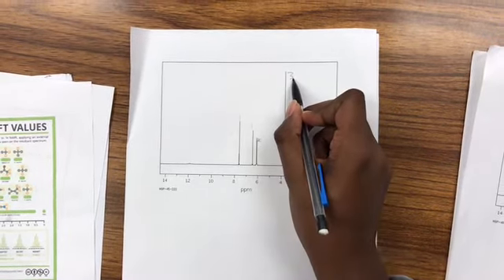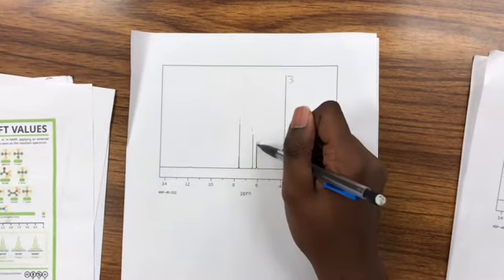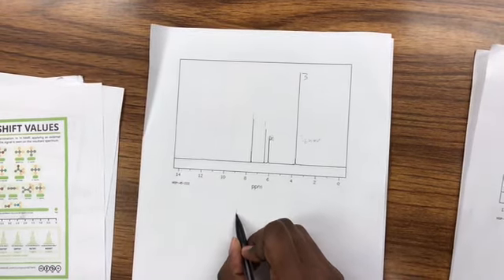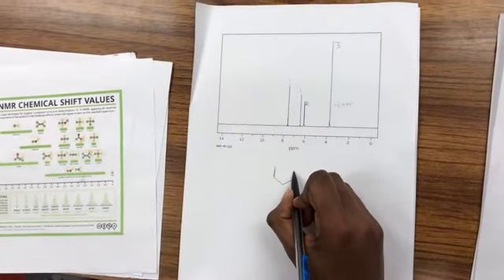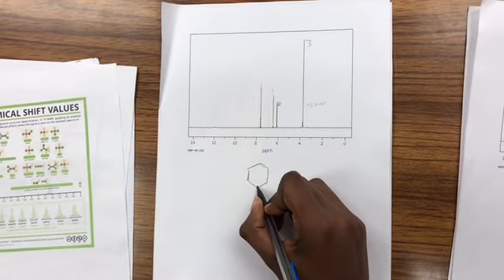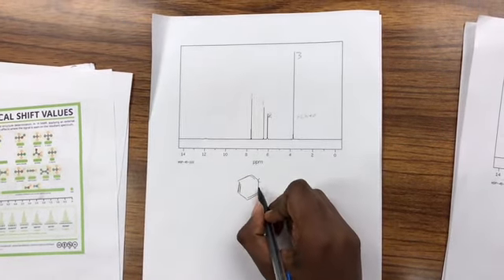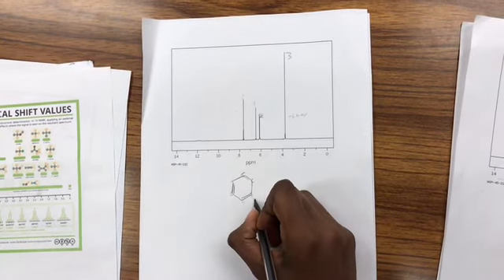And now let's look at the H NMR to try to figure out the structure. Here I labeled the integration numbers 3, 1, 1, and possibly 2 over here. And we can try to draw our molecule based off this. I already said earlier that based off the IR, we likely have some sort of benzene ring, so I'm going to draw that. Each benzene carbon has some hydrogens on it.